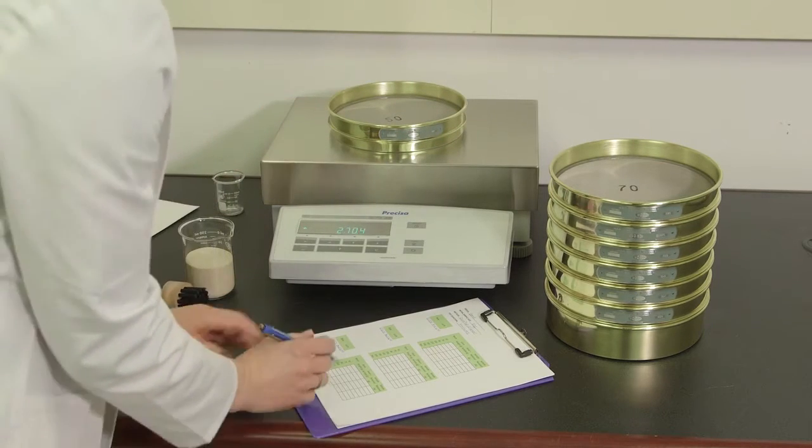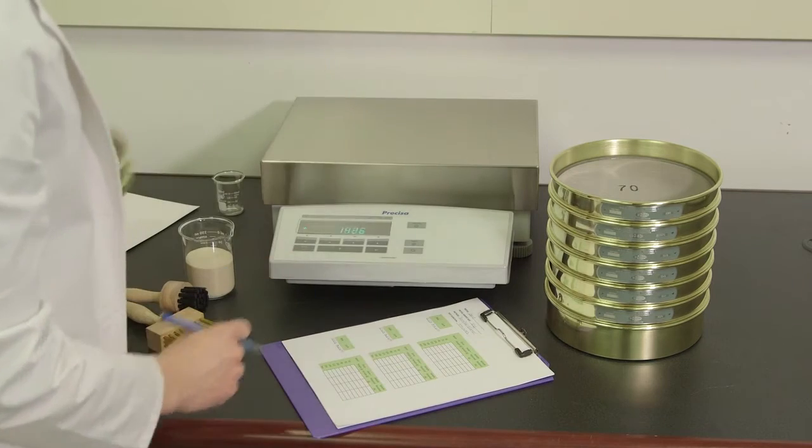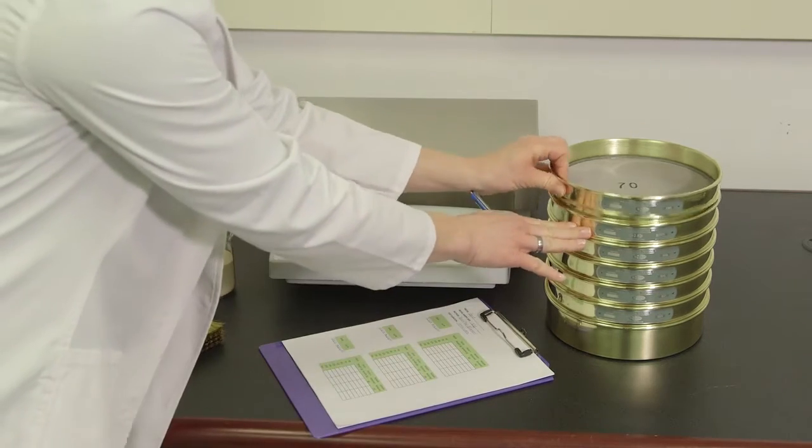Gather all the sieves required for your test as well as your weighing device, means of recording your results, and a sieve brush.